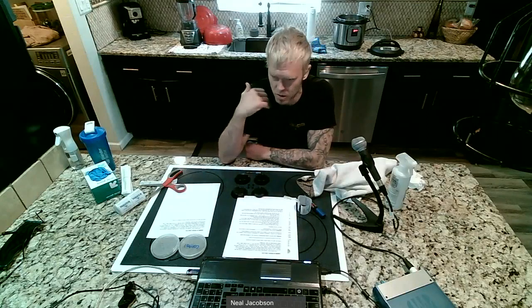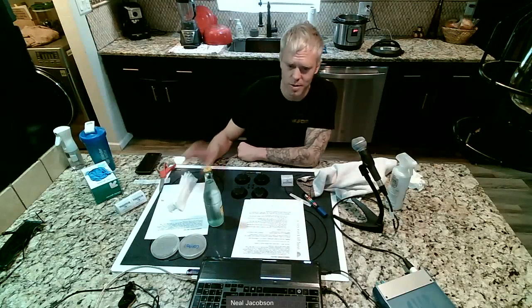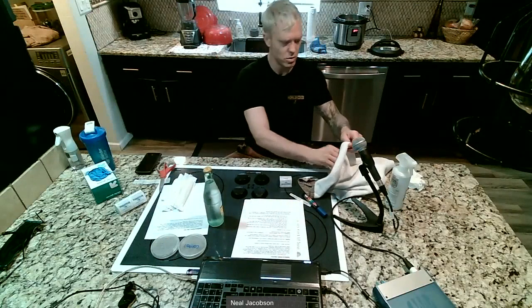I actually don't have bottled water, so what I'm going to do is grab one of our LaCroix sparkling waters. Totally sterile. When I crack it, it's going to be pure water. Granted, it'll have some flavors in there, but that's not going to make a difference when it comes to a petri dish. So I'm going to do that right now. Okay, so for me, I'm going to use my Topo Chico. I just opened it and then I put the lid back on so no dust or mold spores fall into the bottle of water.